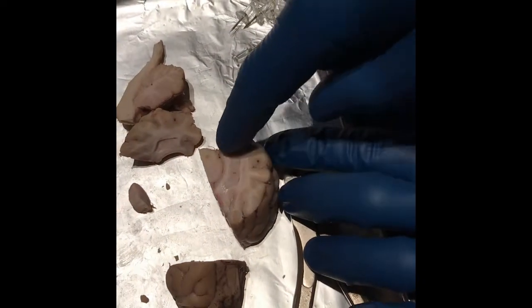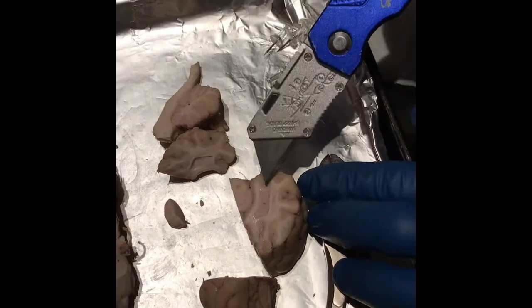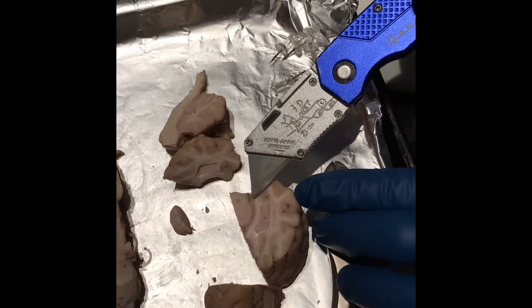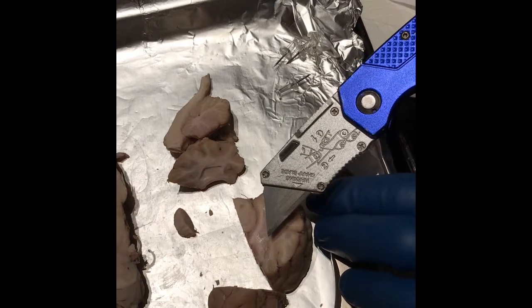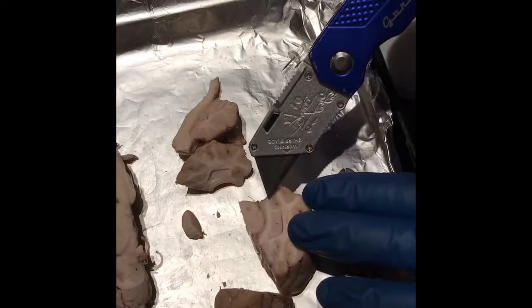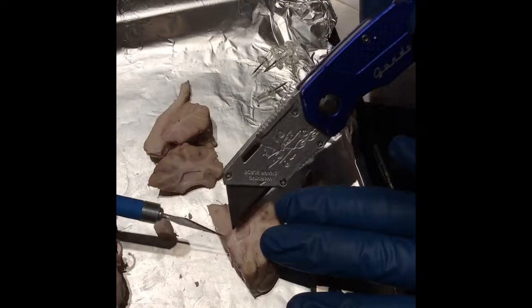So this would be the hippocampus here. And that's part of the limbic system, which regulates long-term memory and spatial navigation. Right. So the hippocampus, and then the medial geniculate nucleus here. And that relays between the inferior colliculus and the auditory cortex. And then the lateral geniculate would be this right here, right? No, I think it'd be this right here. Gotcha, right there.